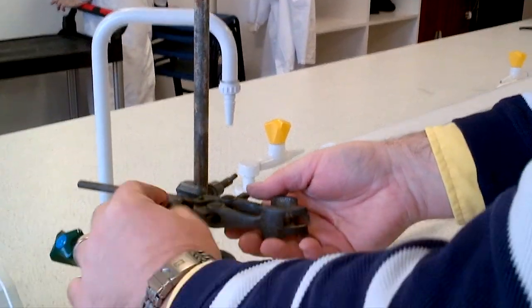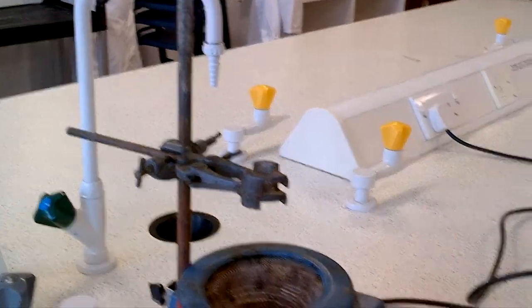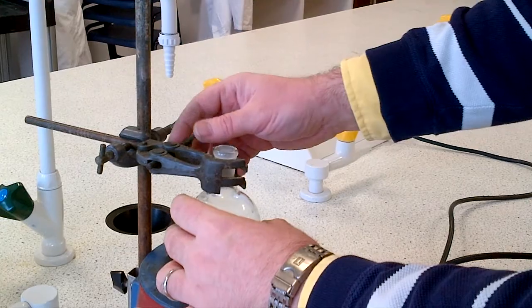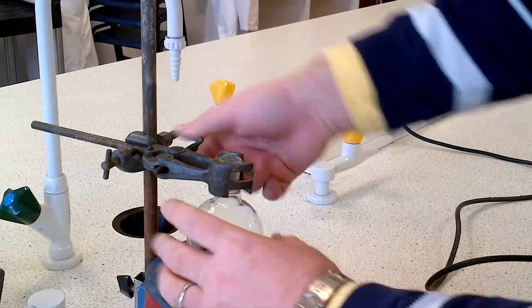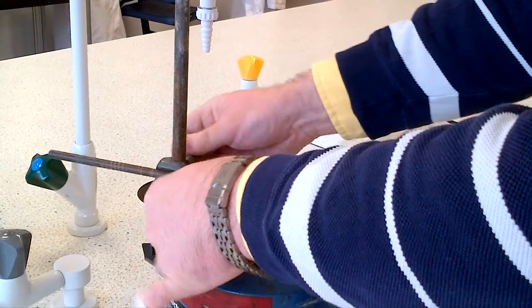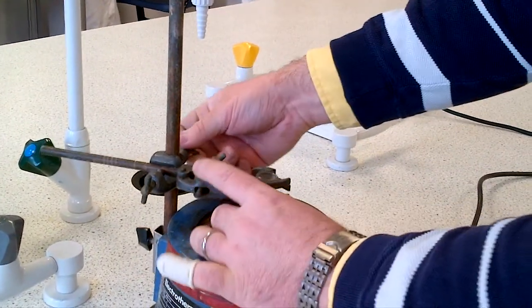Make sure the boss and clamp is set up in this manner. Put your flask—a round bottom or pear-shaped flask—and clamp by the neck of the flask gently. Don't shatter it. Make sure the flask fits nicely into the mantle.